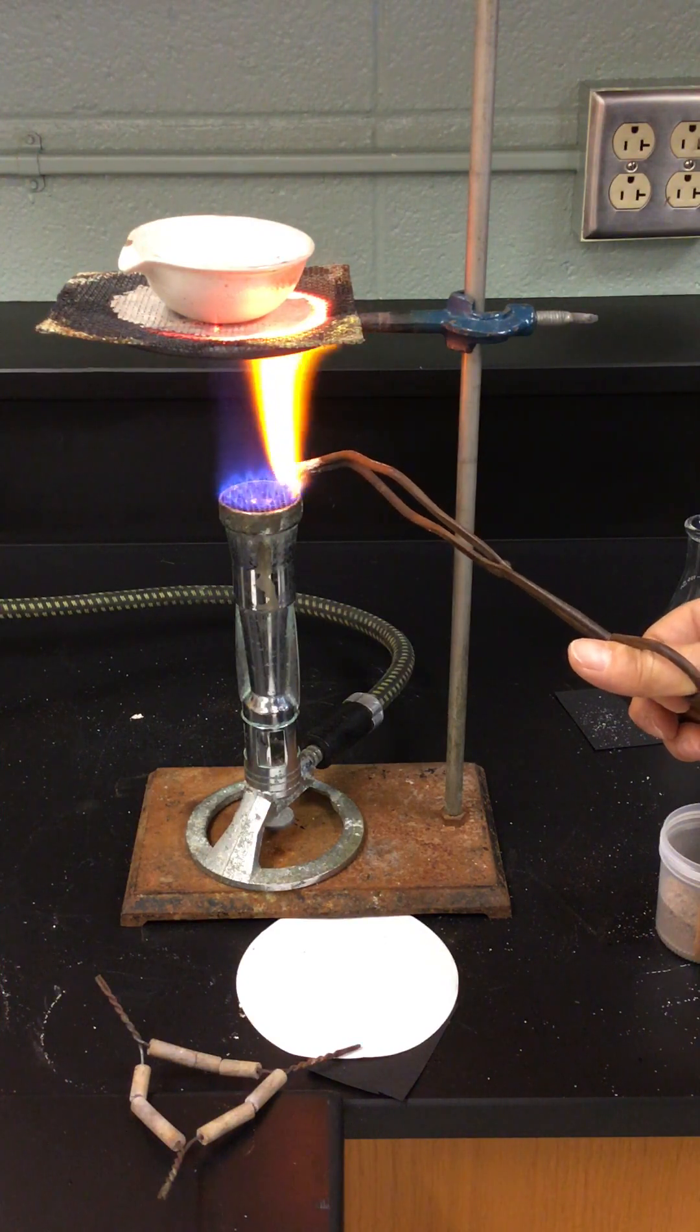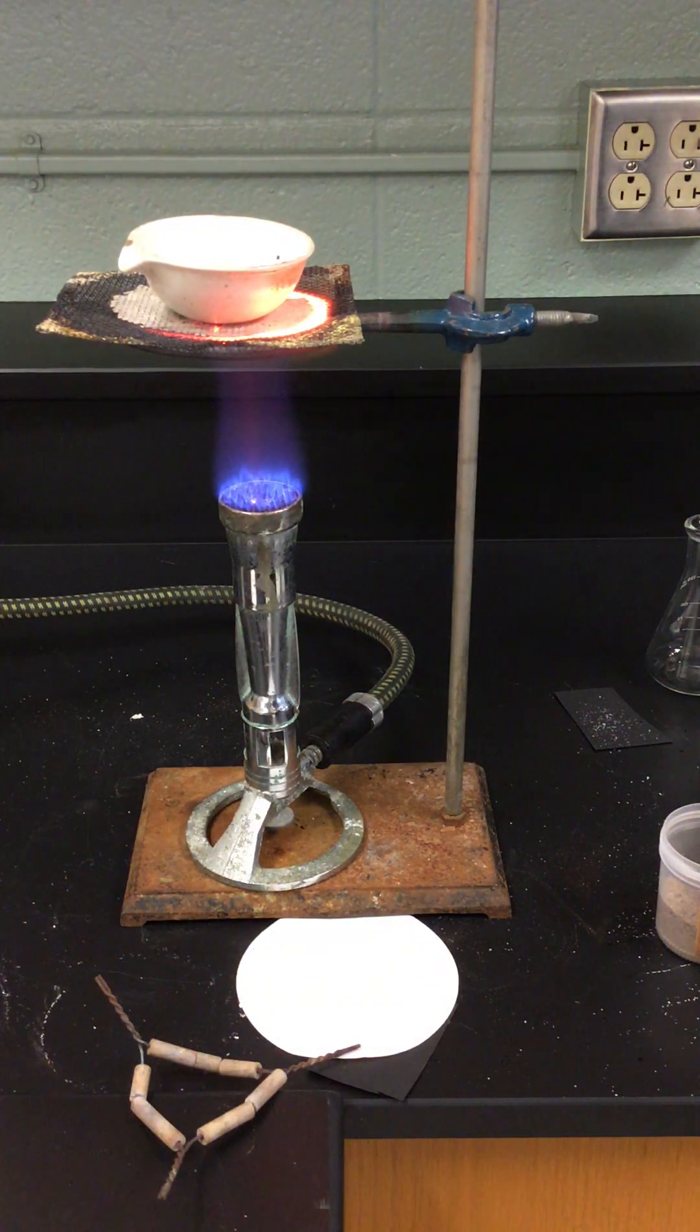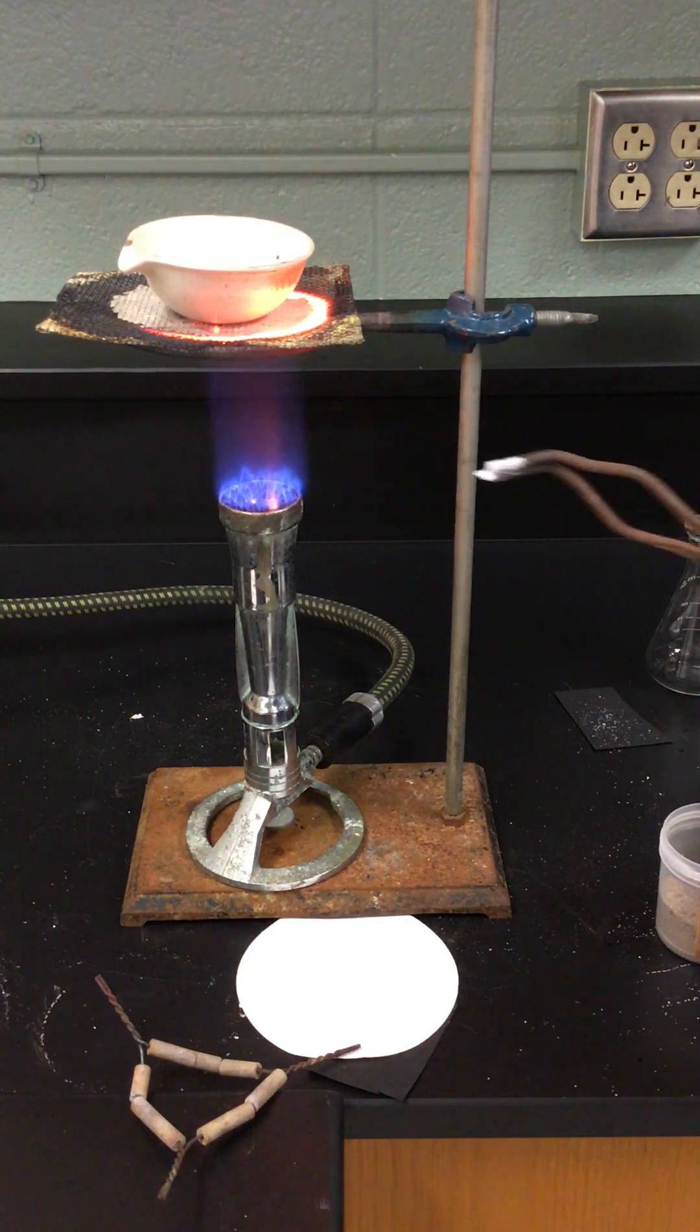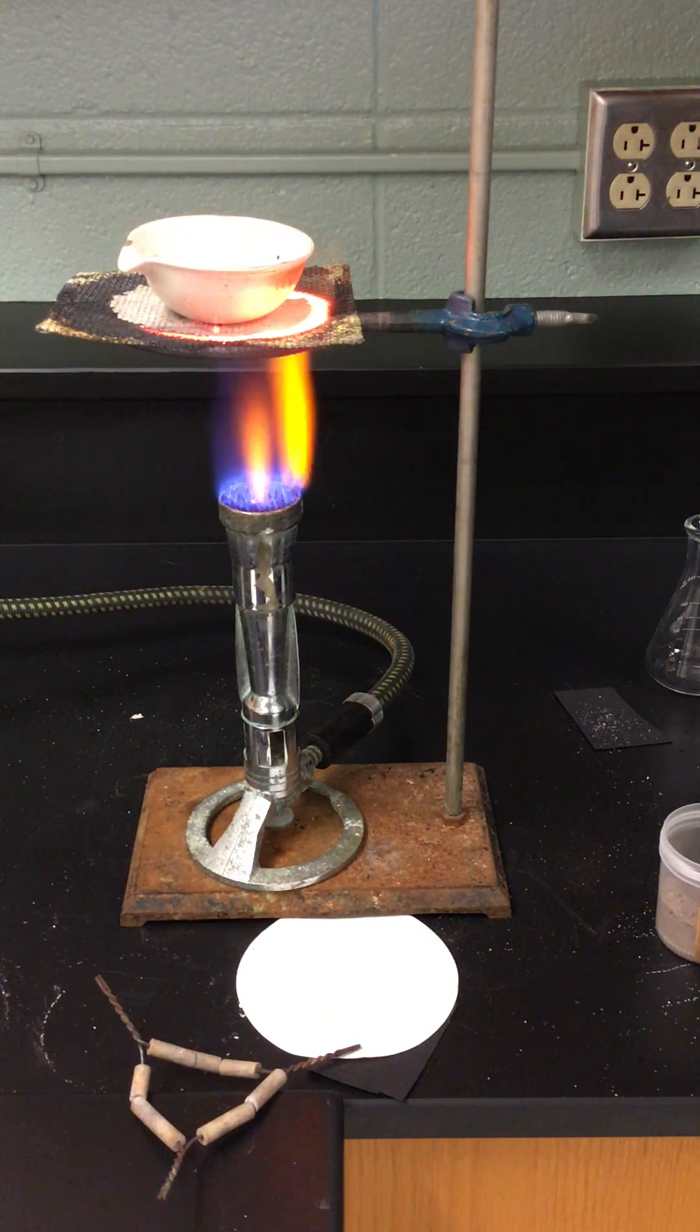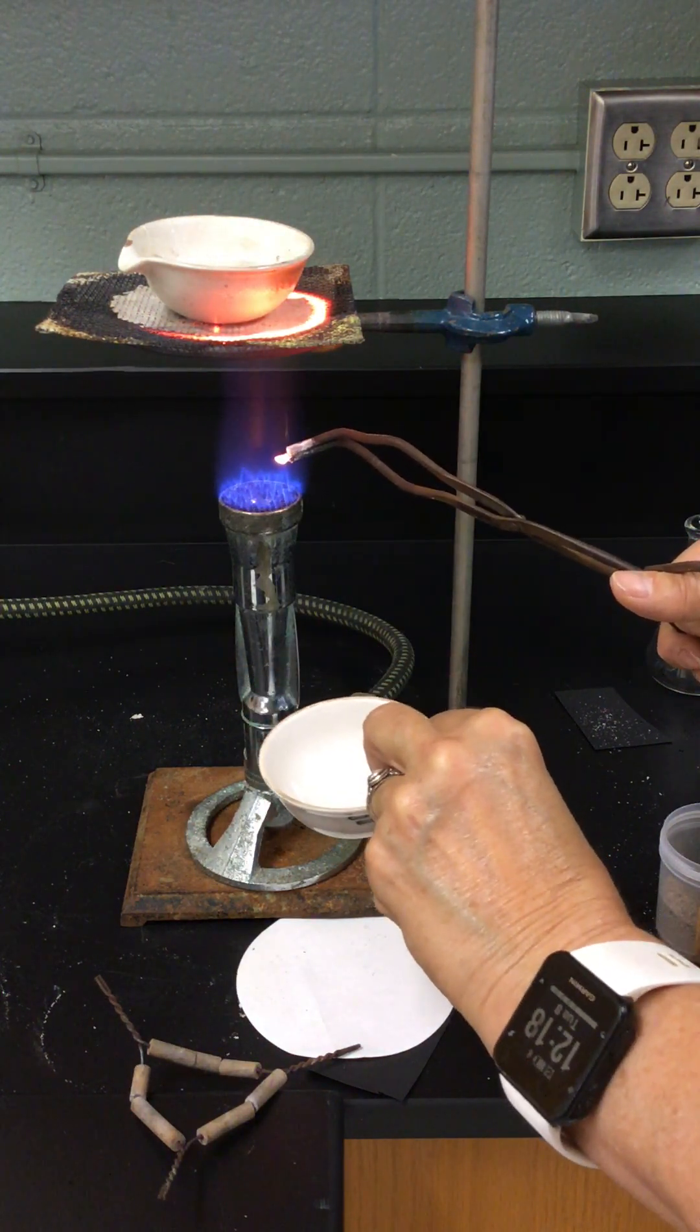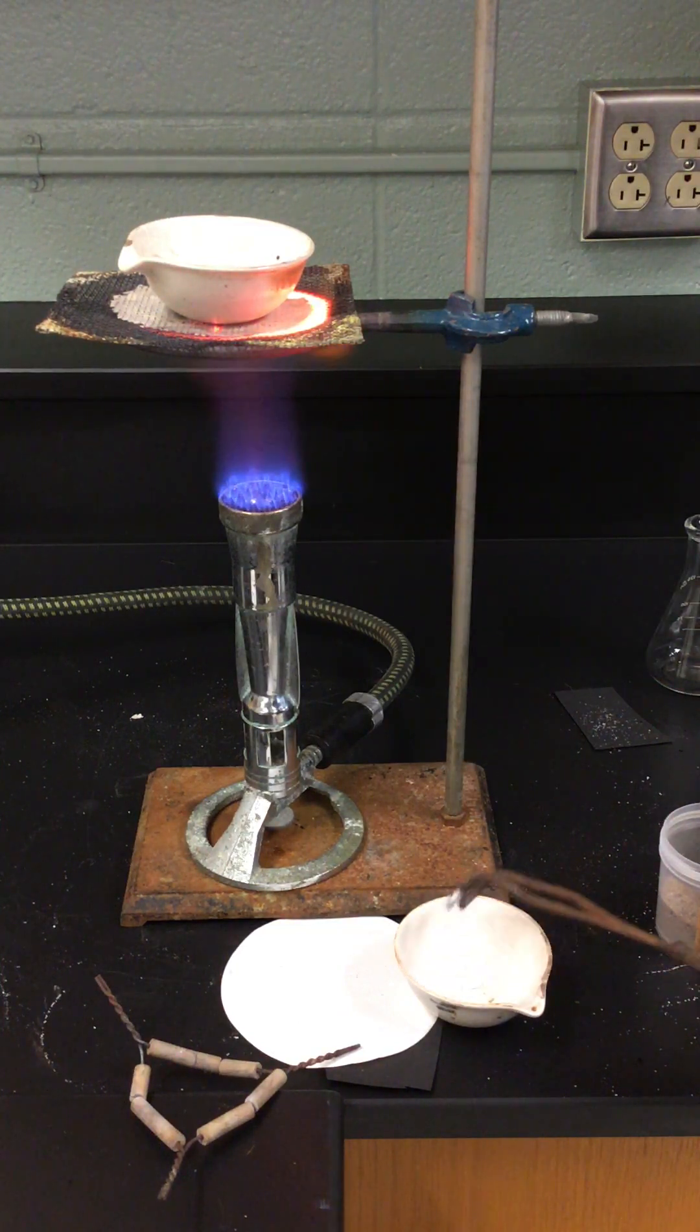Lighting magnesium on fire, whatever part that is, is just sort of fun. Watch it. That was a tiny little piece but I do need some burn magnesium for another part of the lab. So I'm going to get myself another ashing dish, burn this a little bit more just in case I didn't get it all because I need the combustion product for another part of the lab.